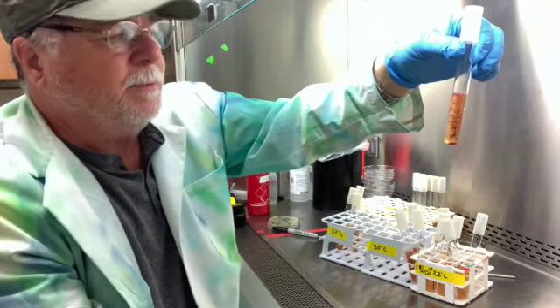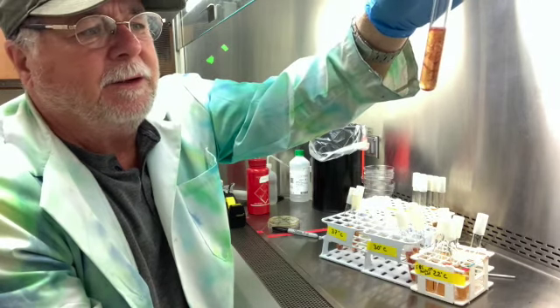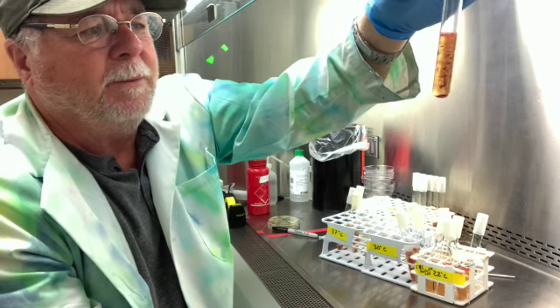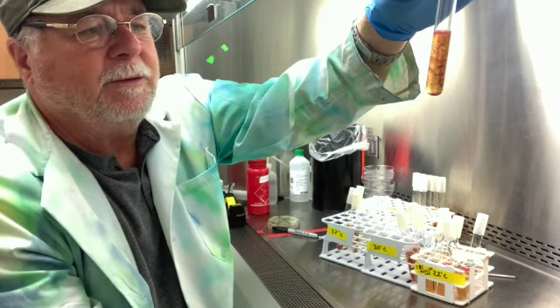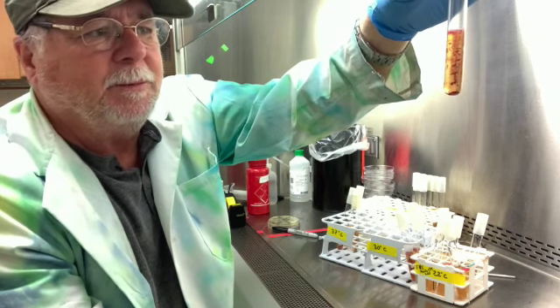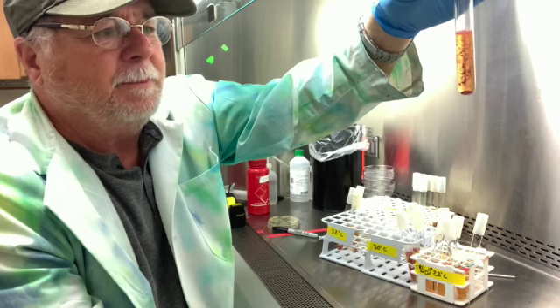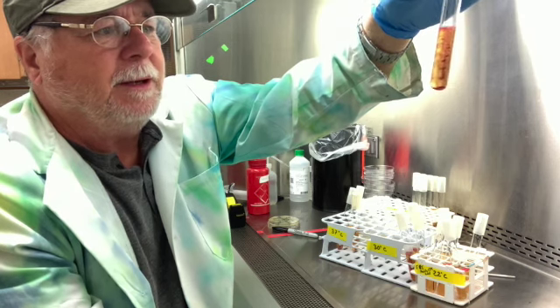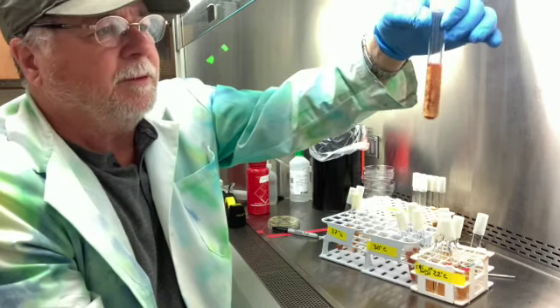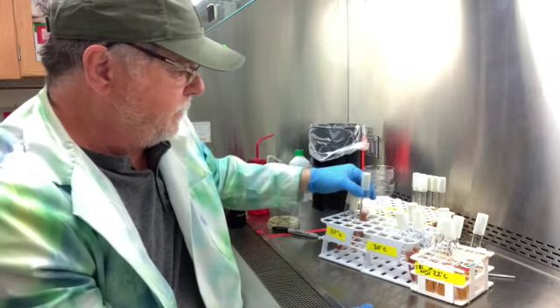And this is number four, Enterobacter cloacae. And you can see it's growing throughout everywhere, and there's little pockets where it's growing. It creates its own gas from fermentation down deeper, and so that will be an area where you can see extra growth. And so this is a facultative anaerobe, and it is motile. This is number four, Enterobacter cloacae.